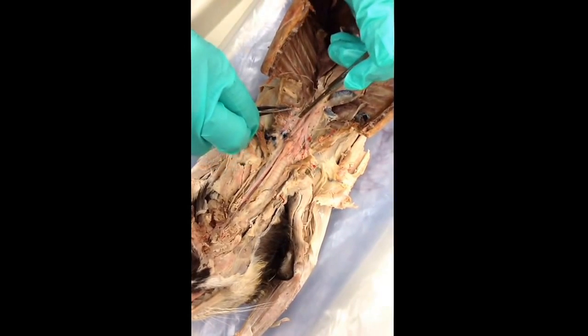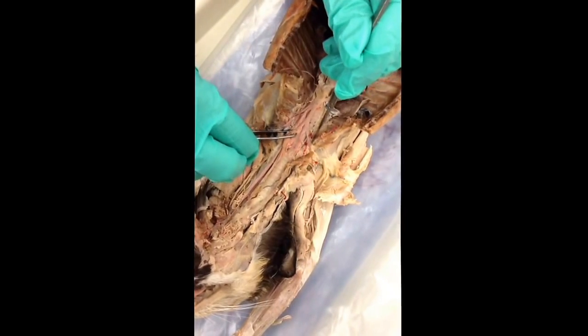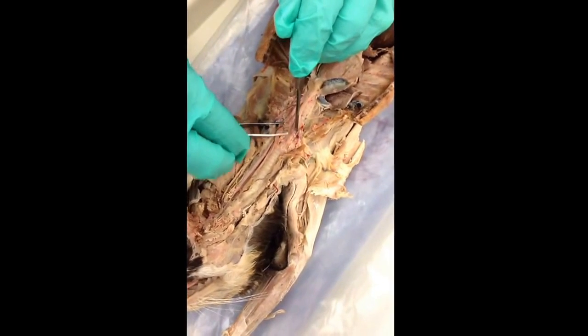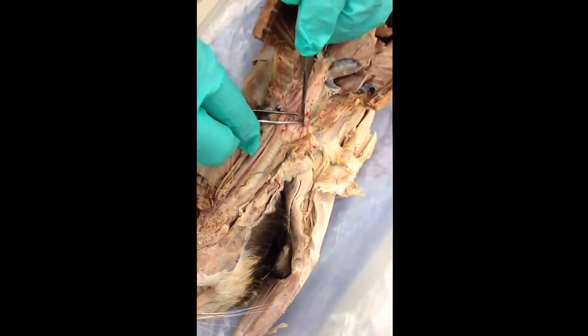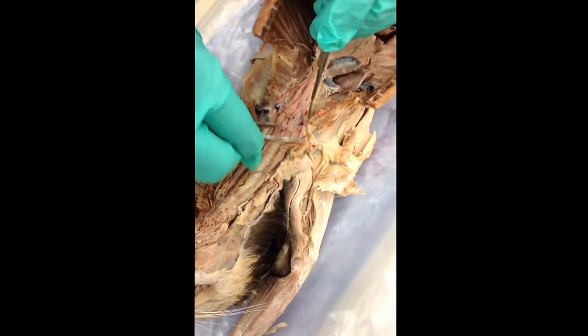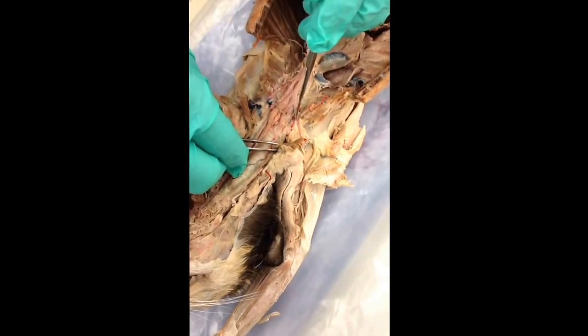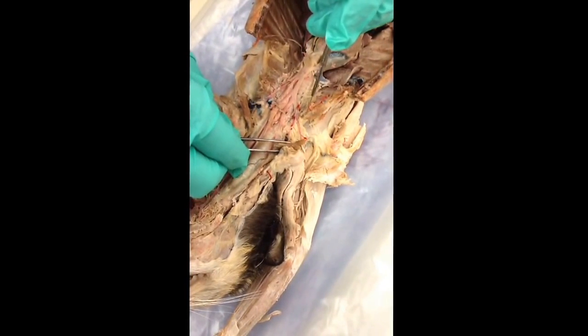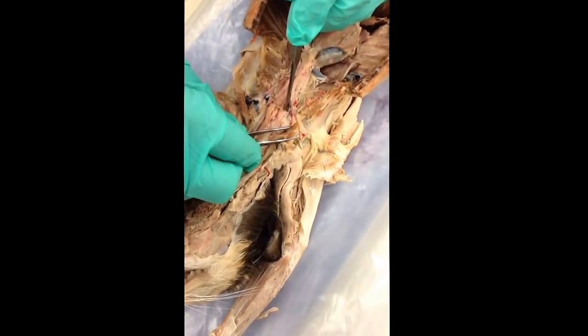Well, it's a little bitty thing. But the internal mammary is broken here. But we do see on this cat the vertebral. There is down in there a second one, which is the costocervical, and the third one is the thyrocervical, VCT. Sometimes they're a little bit better injected, but we just have to deal with what we've got.